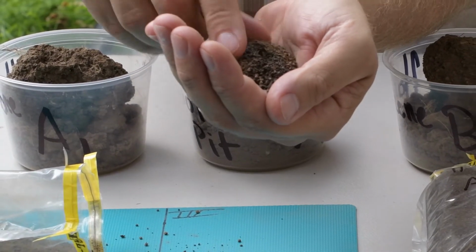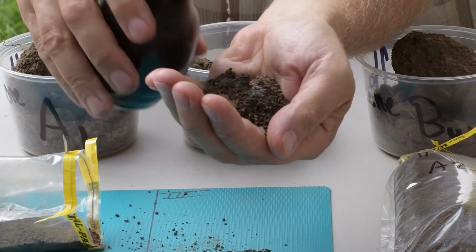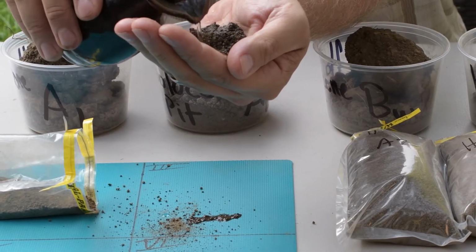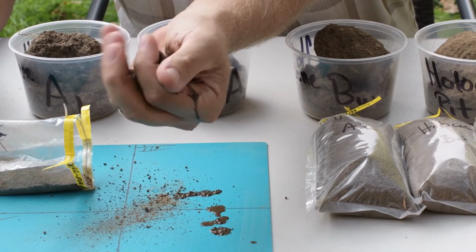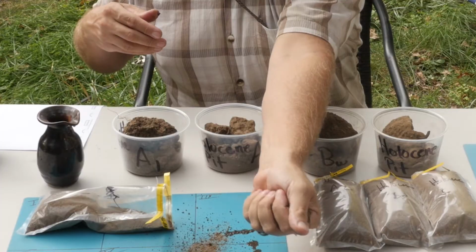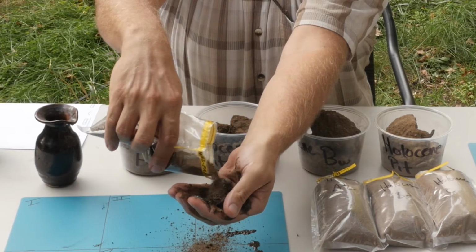Now, this isn't ideal. A lot of times you might have a little spray bottle or a wash bottle like you would have in chemistry that allows you to control the amount of water that you add, how fast and where you put it. One good thing is that no matter how wet you make it, you can always add more soil. So in this case, we got this nice ball started. It's a little drippy, a little juicy, so I'm going to add a little more soil to it.